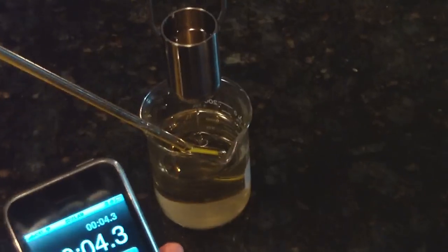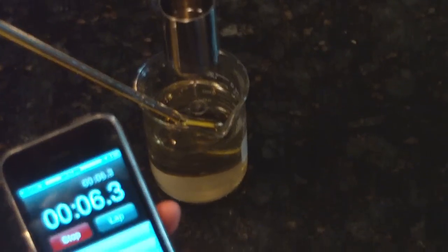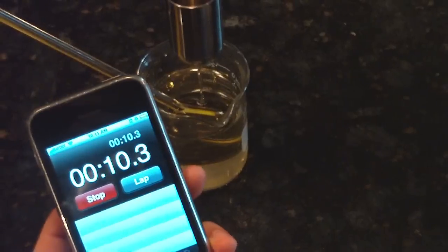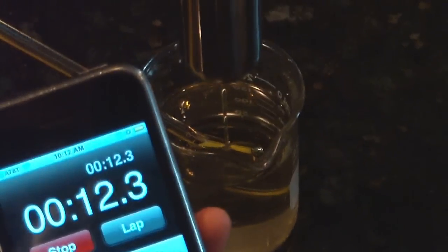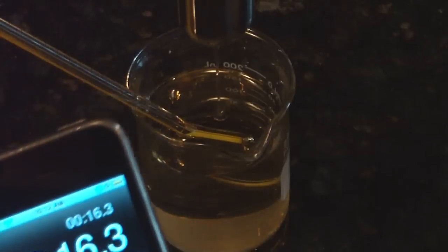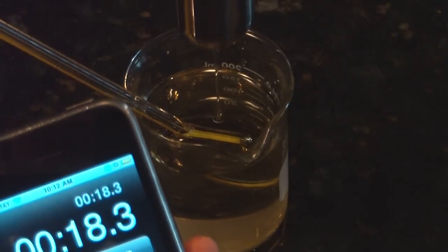Now you wait for the cup to empty while recording the time. You need to stop the stopwatch at the first sign of a break in the stream.